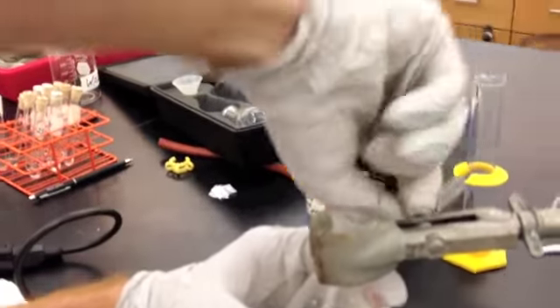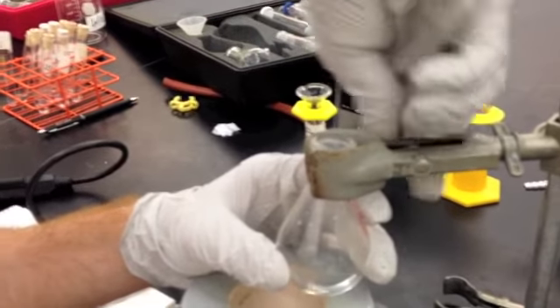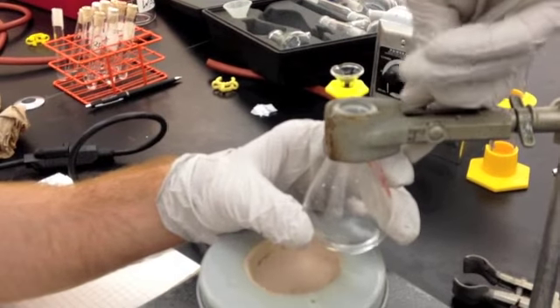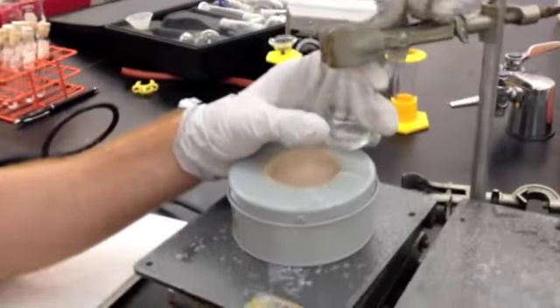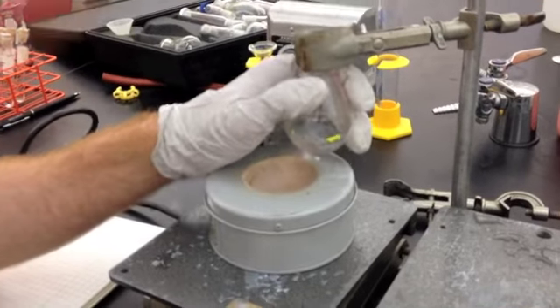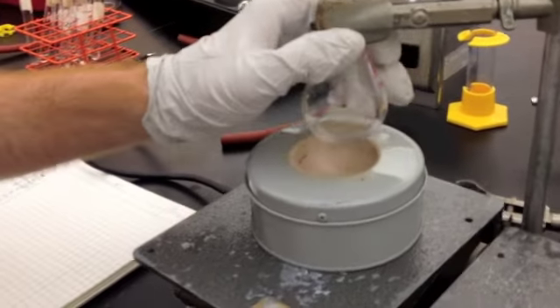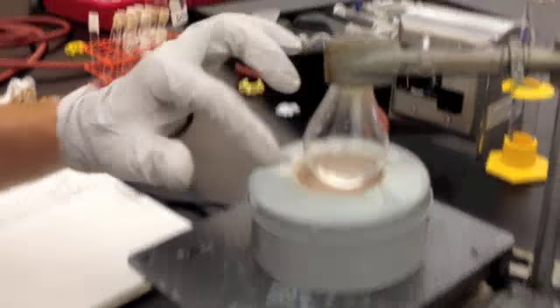You want to also use these two lab jacks in case it gets a little too hot, and then you can put it down, cool it, and then you raise your lab jack. This is your heating mantle, 50 milliliter. Make sure the size matches up.